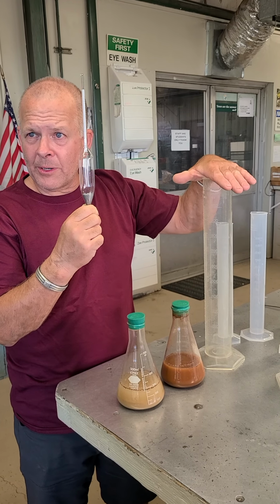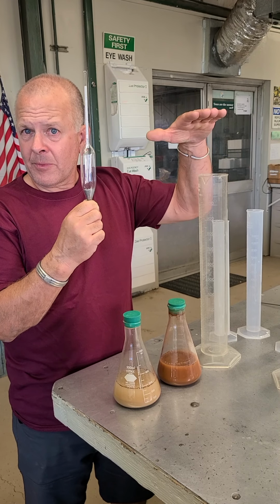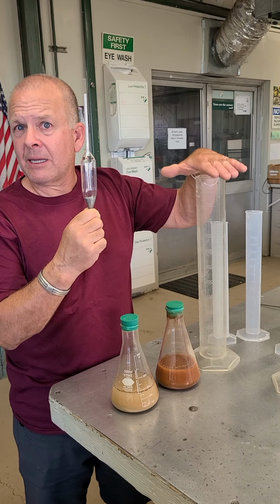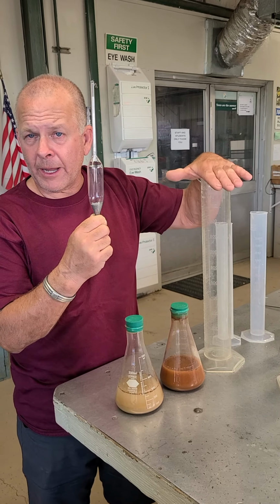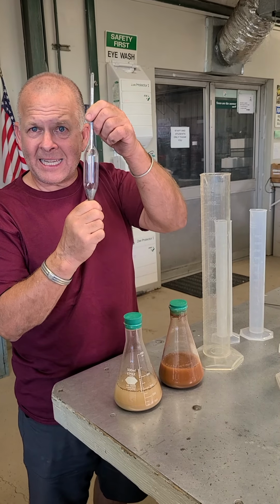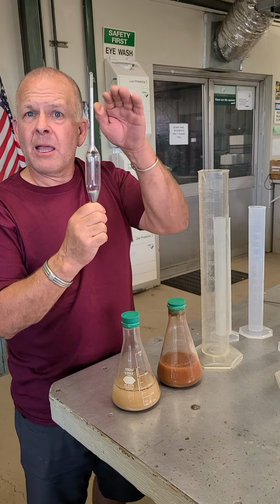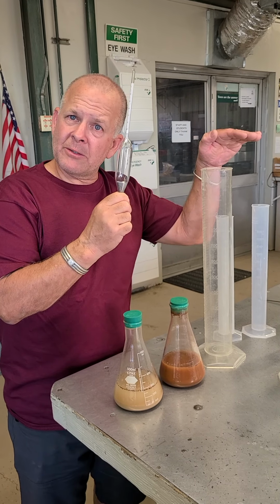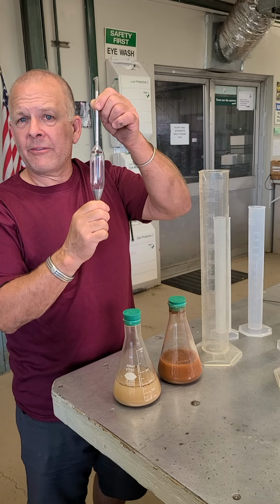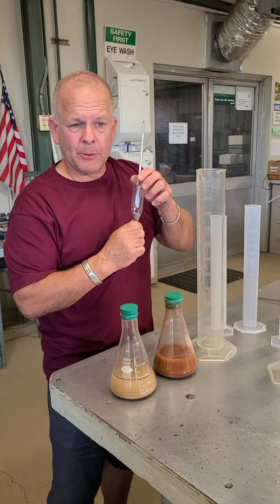So what's important is, as I said, to know what the solution is made of, what the density is, get the exact amounts of soil, the exact amount of HMP, and everything else has to be distilled or purified water, right? Then, knowing that, everything's going to be the same. When we measure the density at a given time, by plugging the data into Stokes' law we will know the proportion of sand and the proportion of clay remaining in the suspension. Does that make sense? Hopefully it will. If not, the visual will probably help you understand what we're doing. Okay, I'm going to go ahead and put this hydrometer down.